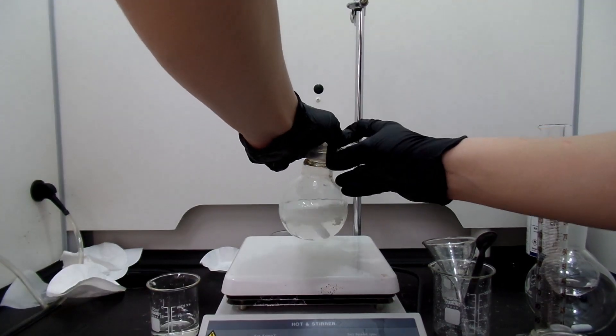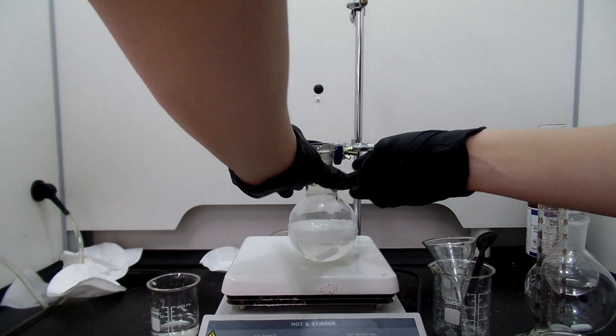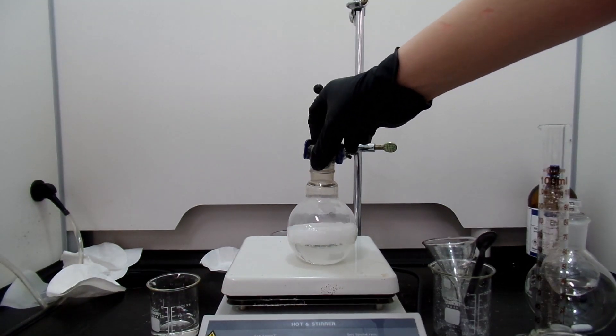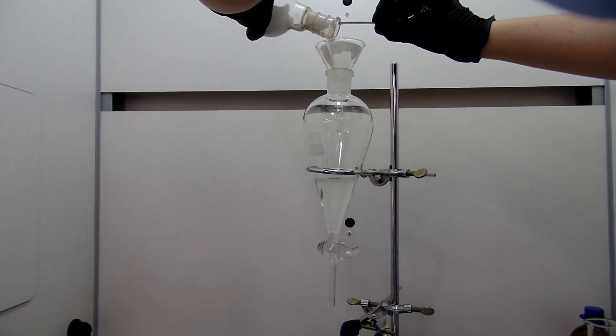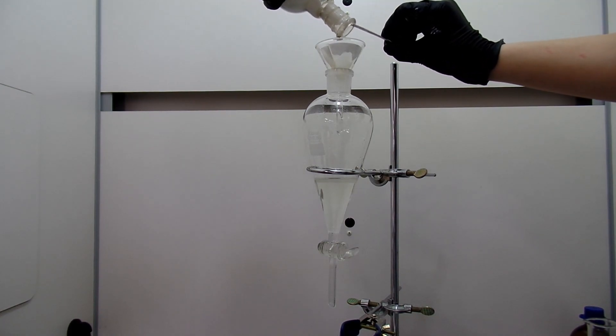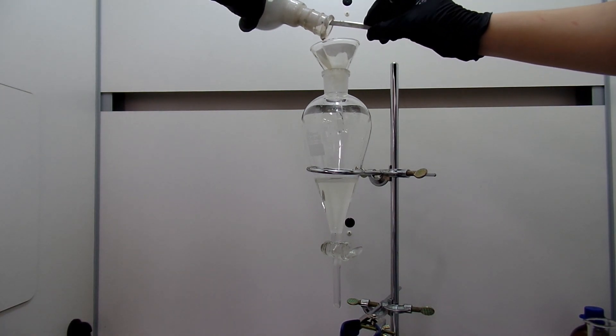After one hour, there were two separate layers and the upper layer is sodium benzoate and below is benzyl alcohol. I obtained the lower layer and filtered upper gelatinous solids because it contained quite a lot of liquid inside.